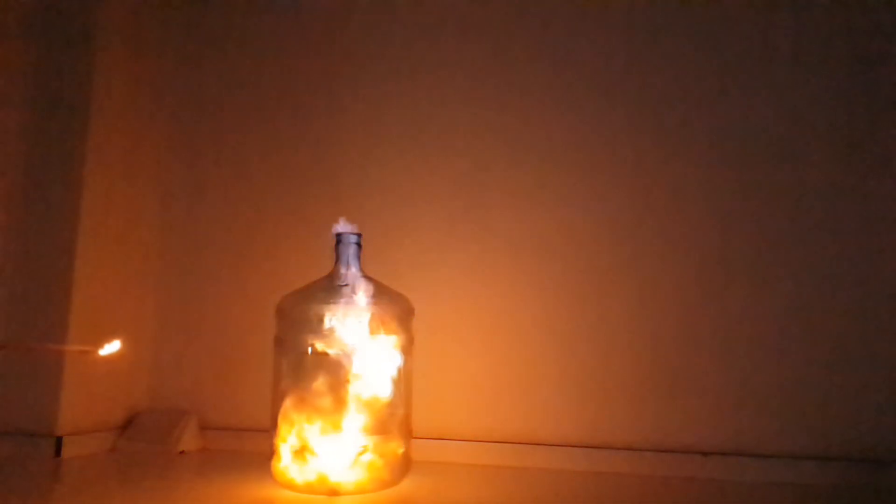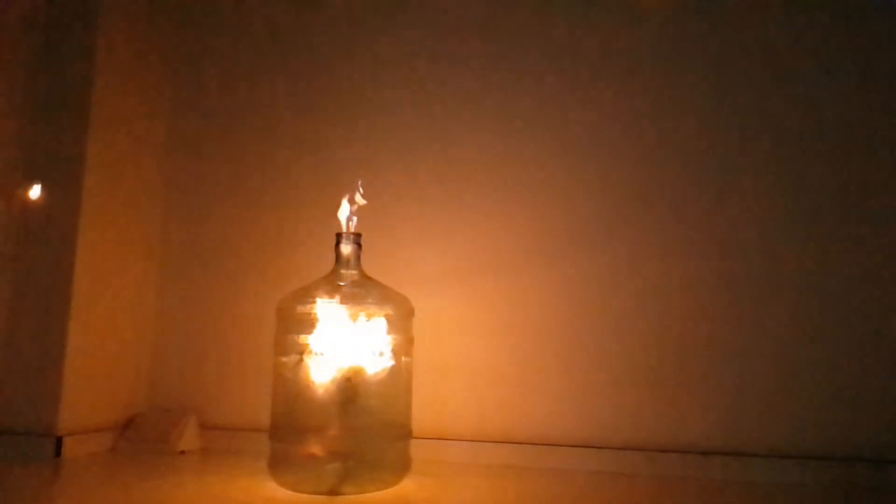This oscillating effect we see is because the oxygen inside the container is running out. As this happens, the reaction slows and the container cools, creating a small vacuum which draws more air into the container.